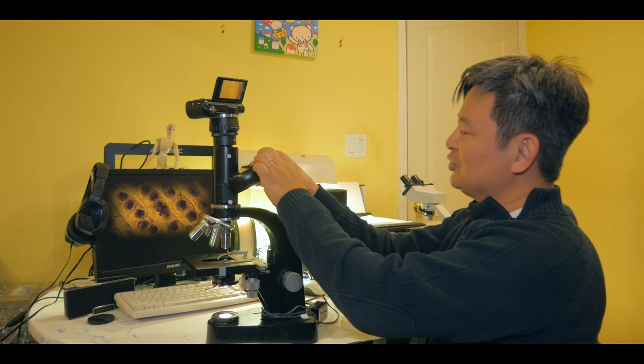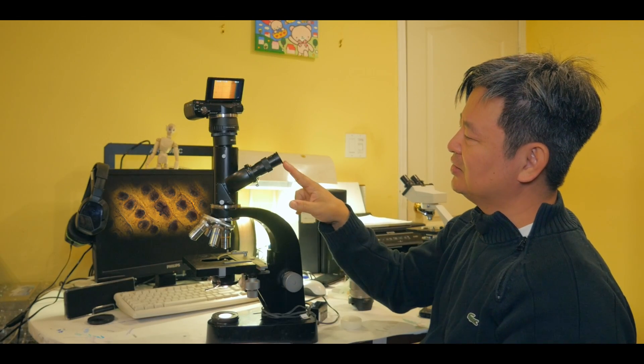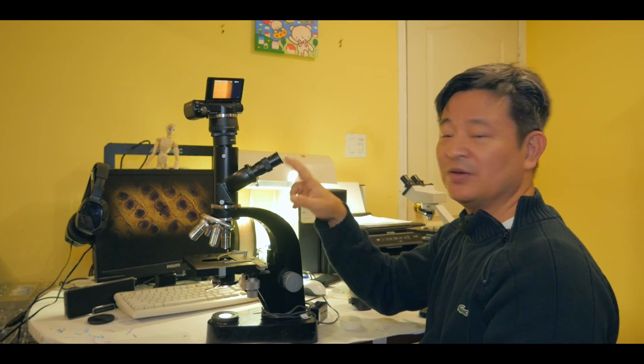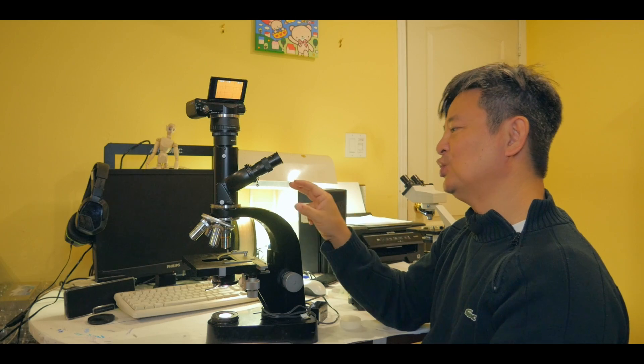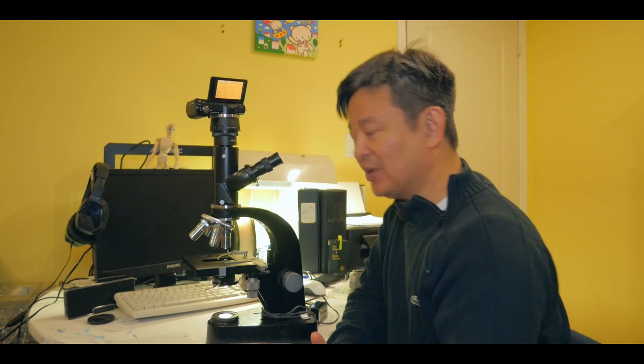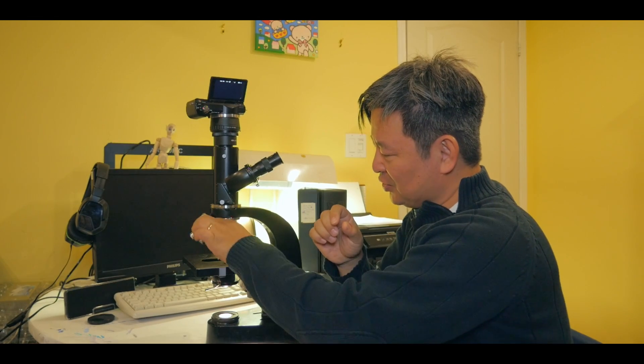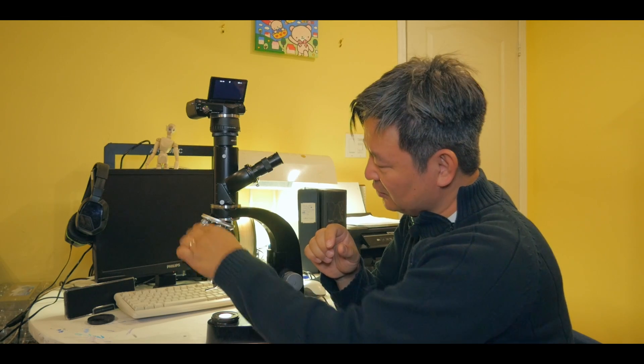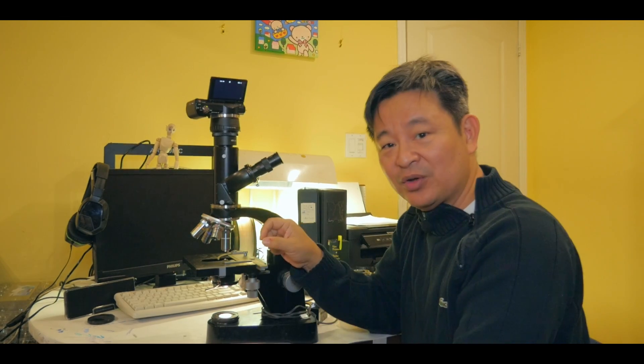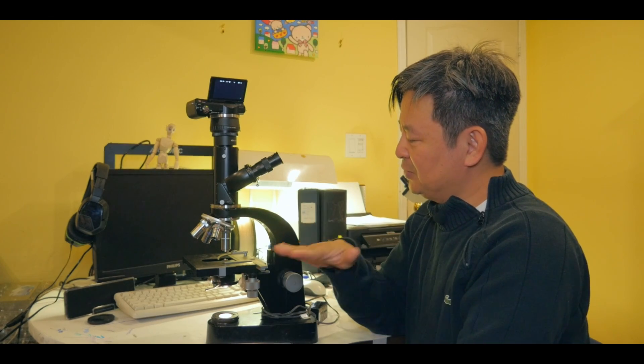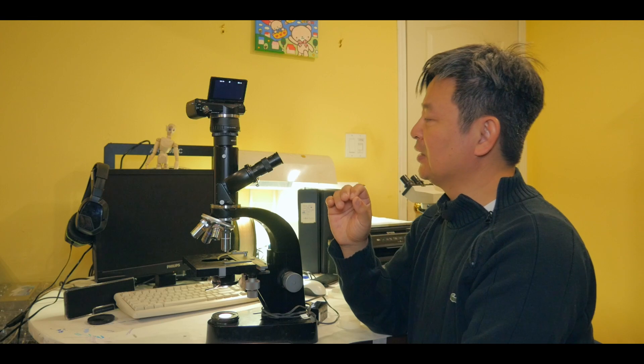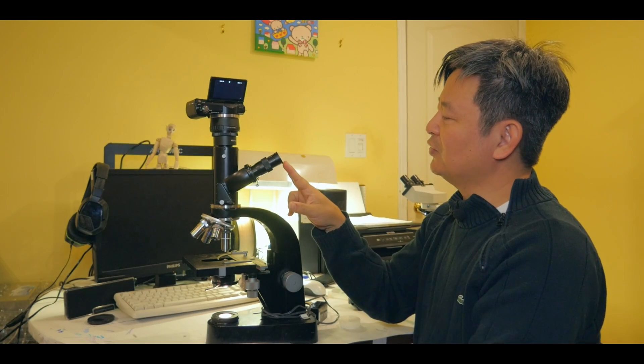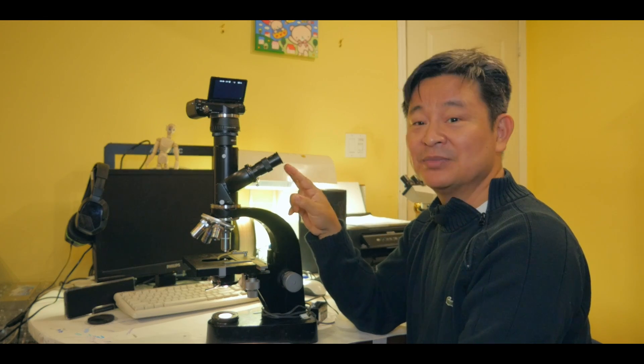Now I also modified the ocular lens here. It's originally was 10 times. I could put in a 20 times or 25 times. Okay. So now this microscope can actually do 2000 times magnification. And it does a really good job. I actually tried it already. I had a image that uses oil immersion 100 times. This one here. Where is it? Yeah, this one here. 100 times with oil immersion, add a bit of oil and then put it on the slide. And I was able to see the image pretty clearly. And in addition, I changed that 10 times to 20 or 25 times ocular lens. So in theory, I'm able to get 2000 times. In fact, I was able to see it 2000 times. It's pretty good actually.